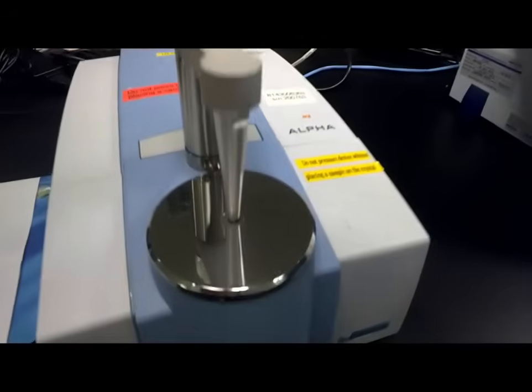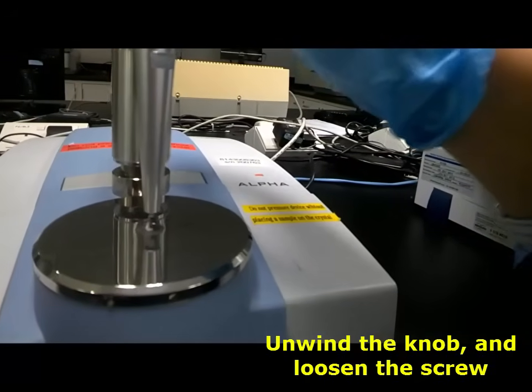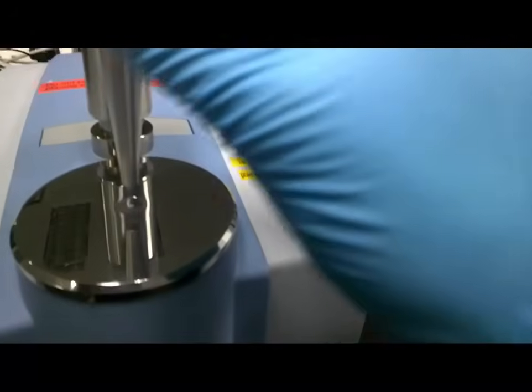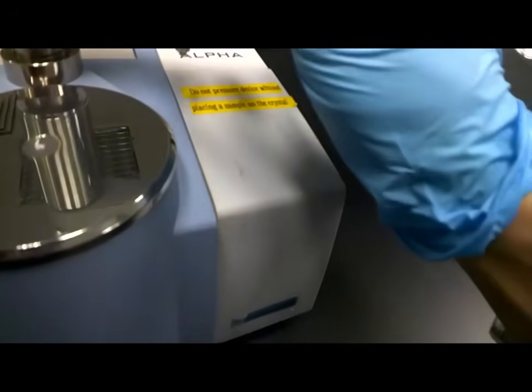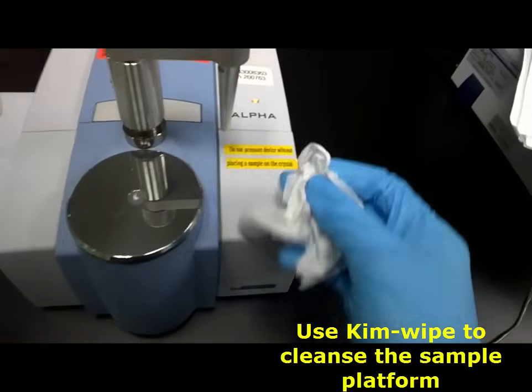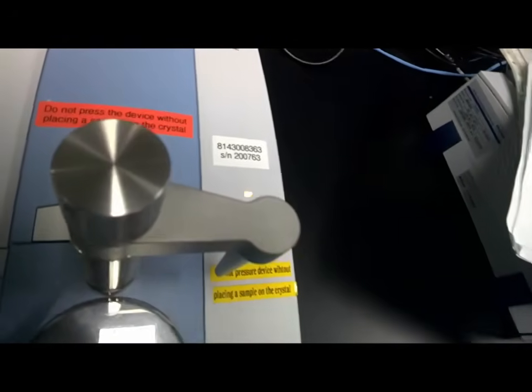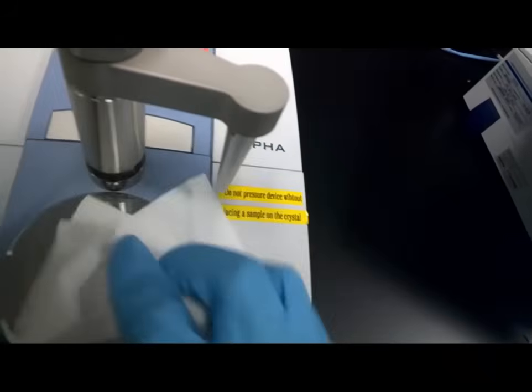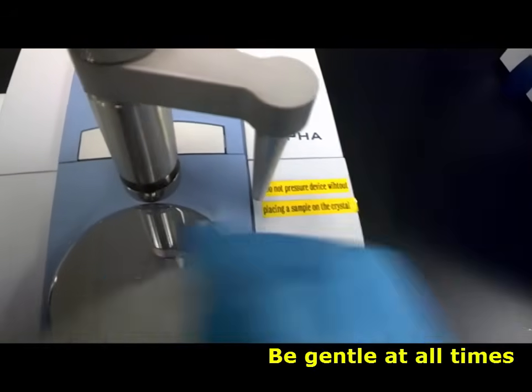After you're done, back to the sample holder. You rotate the knob and screw it in the other direction to loosen it. Bring it up and then rotate the knob to the right side — just 90 degrees will do. And use a bit of tissue, wipe it once, get rid of all the solid on the platform as well as on the scanning probe. Then dip it with some alcohol and do the same thing once more — wipe onto the platform and make sure it's all cleansed, and on the scanning probe. Be gentle.